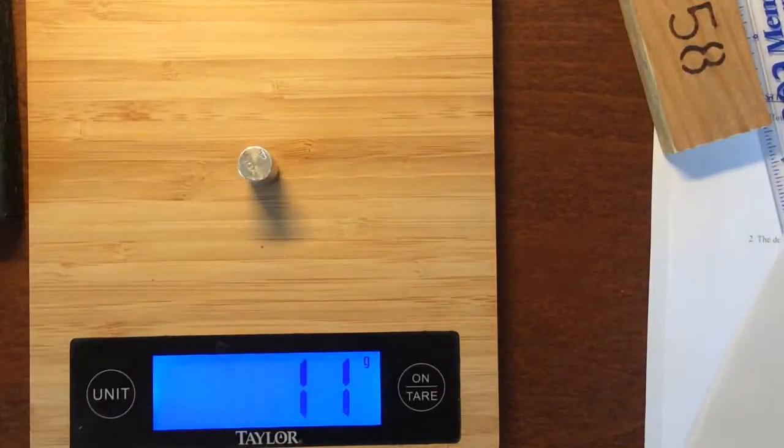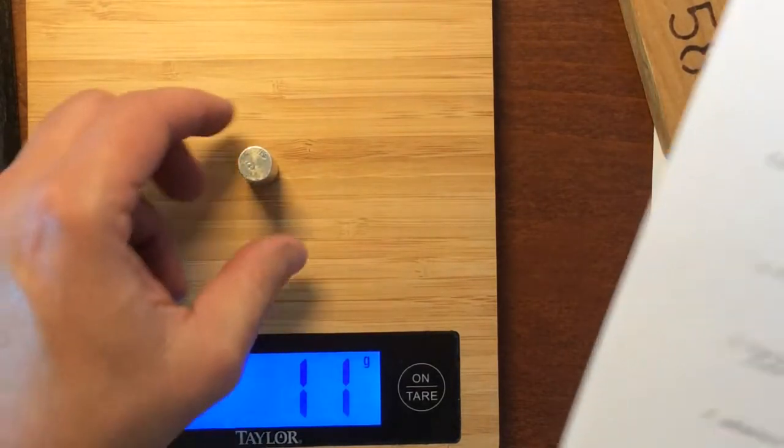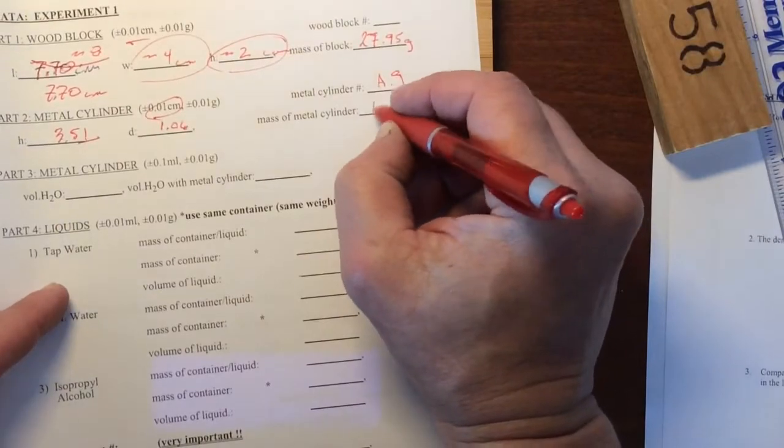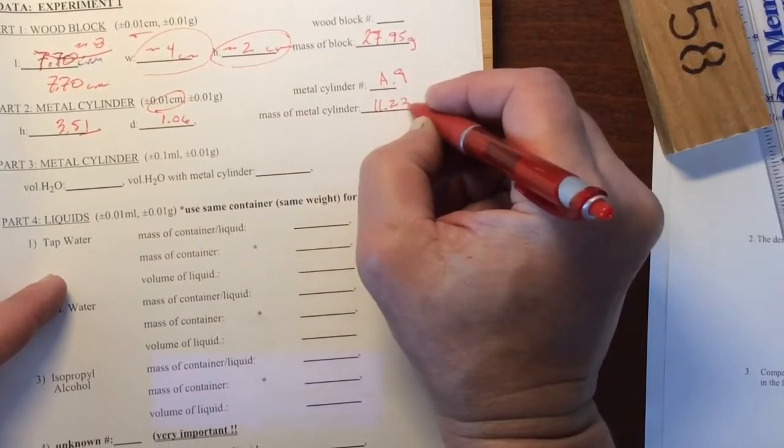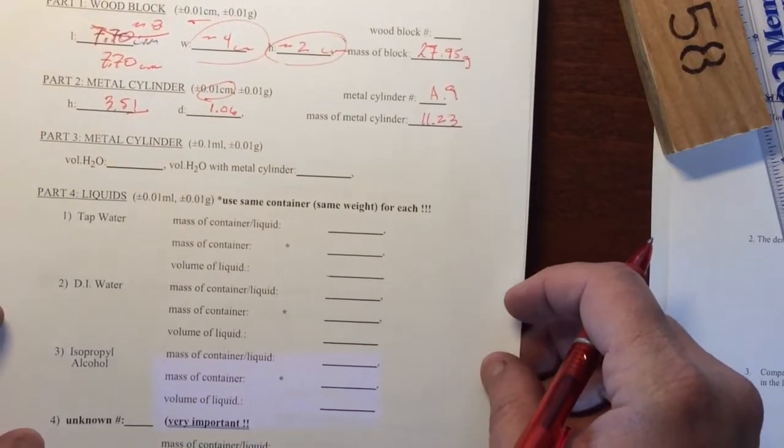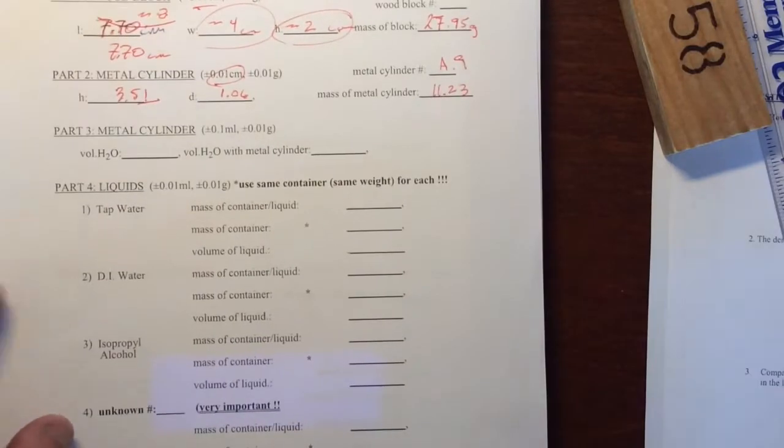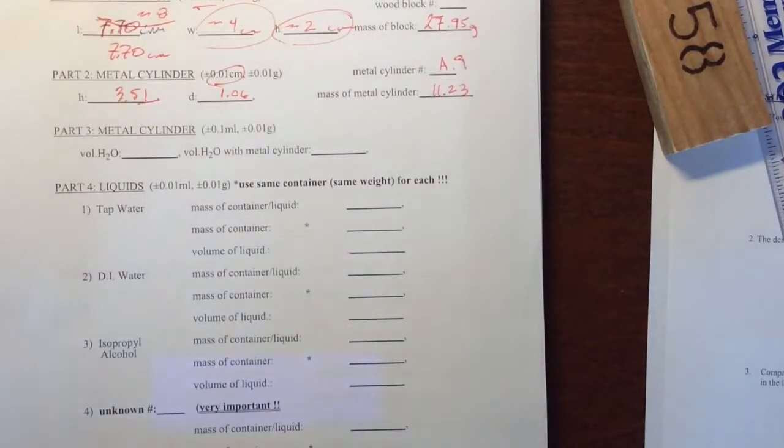We also need to find the mass. So it's about 11 grams. I'm going to say mine was 11.23. If you want to use that, that's fine. If you want to just get a number that would round to 11 but carry that to the 100th place, that's fine too.